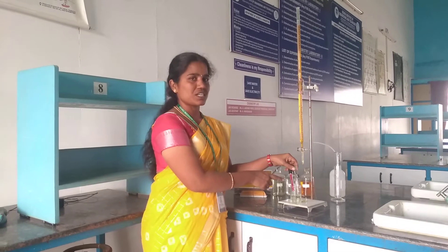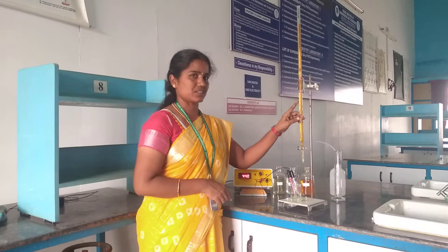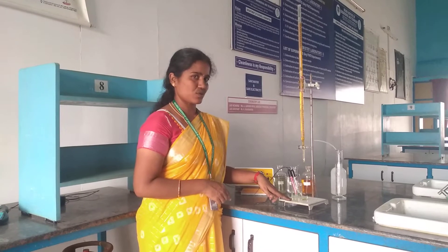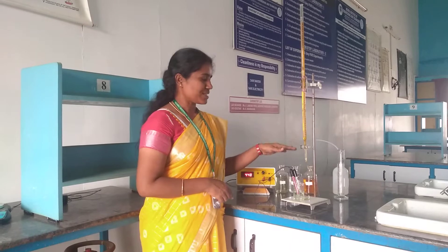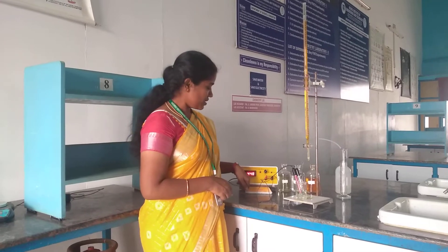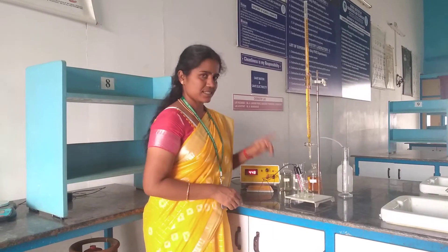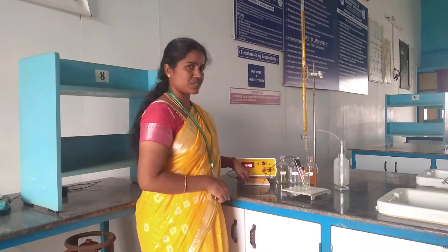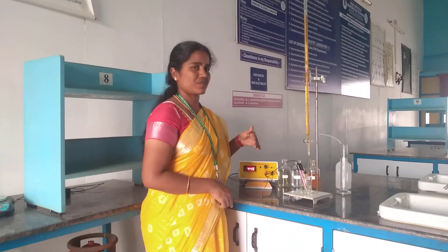Here we are measuring the potential difference created in between the two electrodes by the addition of the reagent, that is potassium dichromate. In this beaker we are taking 20 ml FAS solution, 10 ml sulfuric acid, and a little amount of water. First we need to add 1 ml from the burette, then we are measuring the EMF in millivolts. Our first reading is 448 millivolts. For each 1 ml addition we are taking the EMF of the solution.